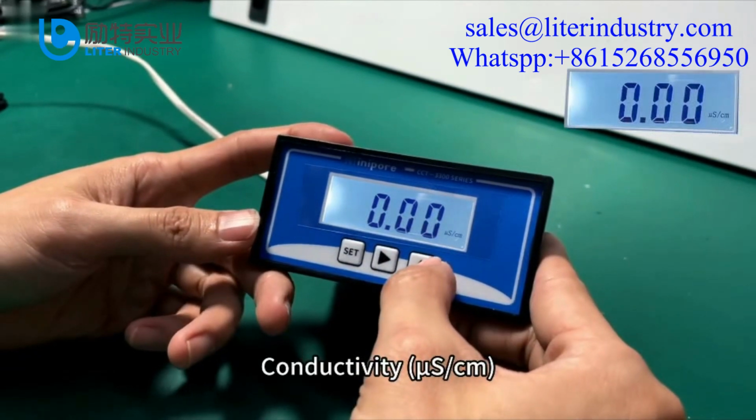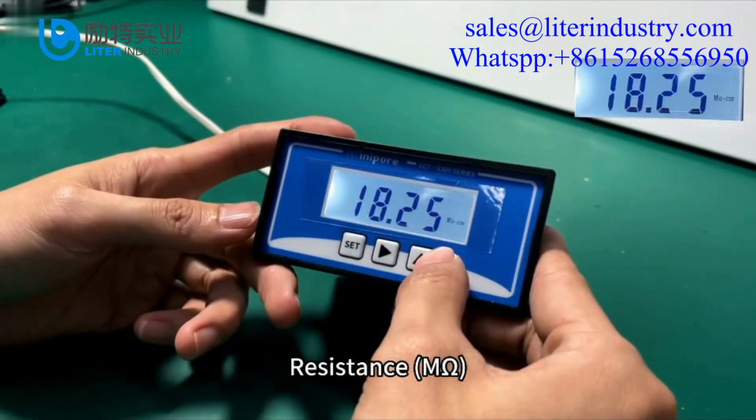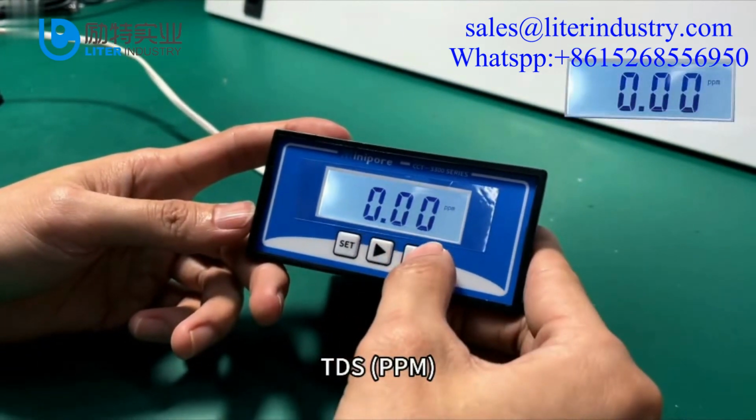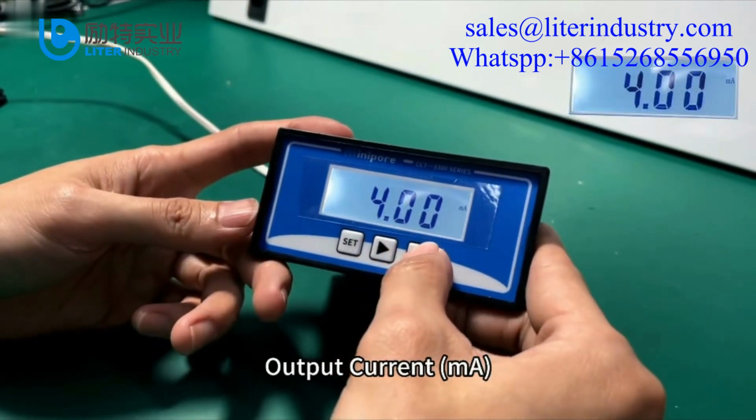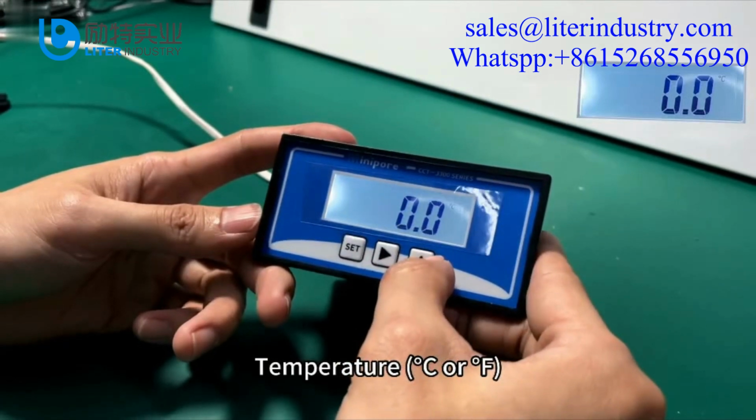Conductivity in microsiemens per centimeter. Resistance in megaohms. TDS in ppm. Output current in mA. Temperature in degrees Celsius or degrees Fahrenheit.